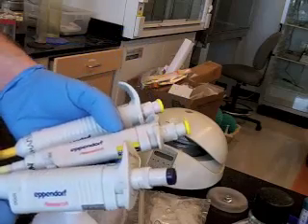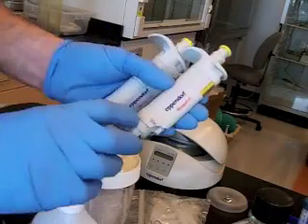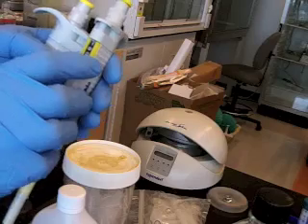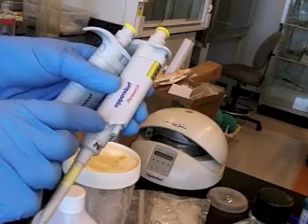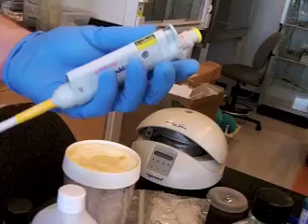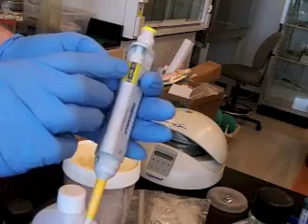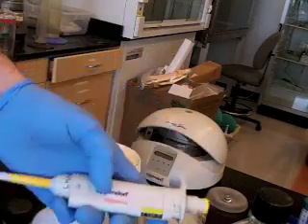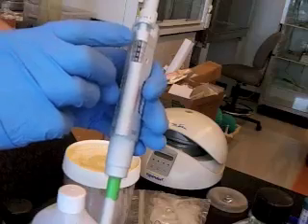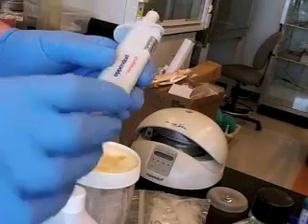The next thing is that the numerical indicator is relative to the volume. For example, this one has got a little yellow line, and that marks the decimal point. We know that's the decimal point because this is going to measure something around 100 microliters, and here it is set for 100.8 microliters. Here's one. The decimal point is here, yellow line marking this. This one measures between 1 and 20 microliters. It's set for 4.36 microliters. This one measures up to 1,000. There's actually no decimal point here. This would be 935 microliters. So that volume is always based on the size range of the micropipetter.